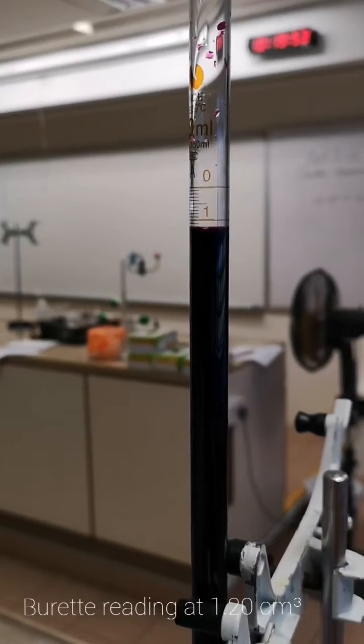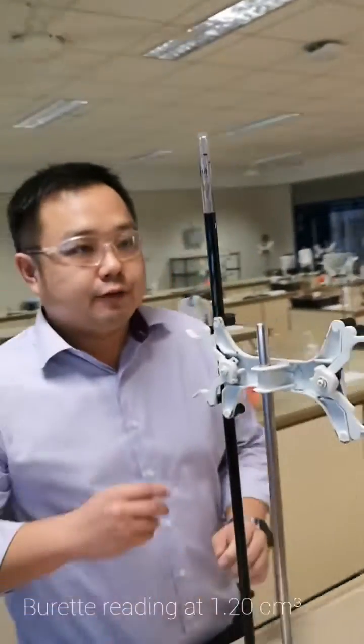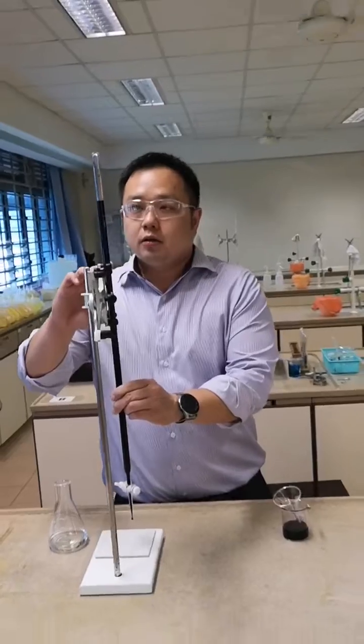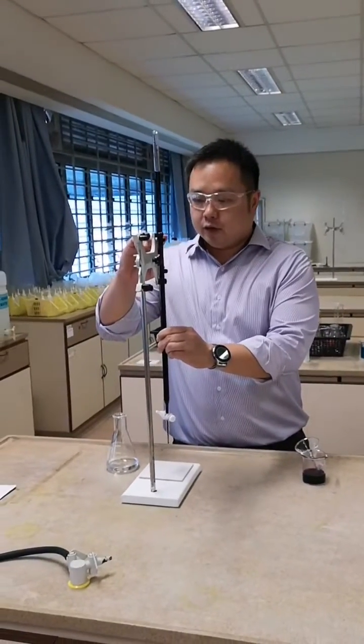Again, a reminder: for dark colored solutions you are supposed to read at the top of the level. Adjust the burette to a comfortable height.